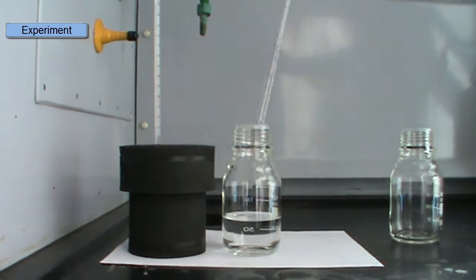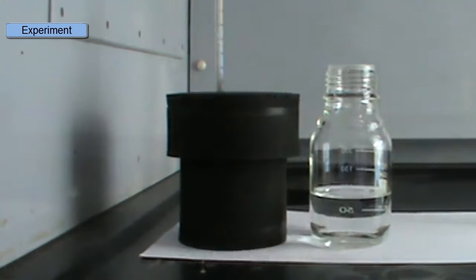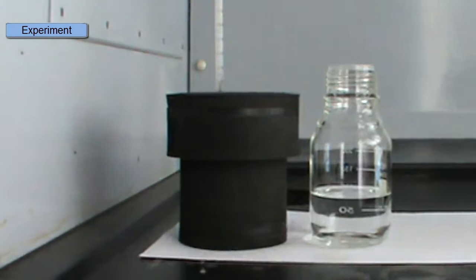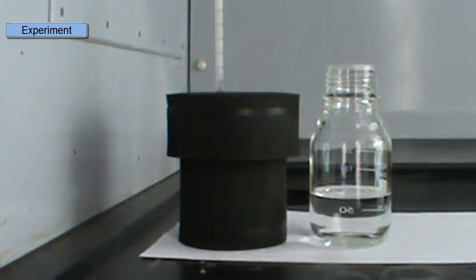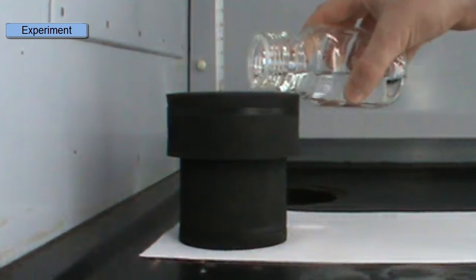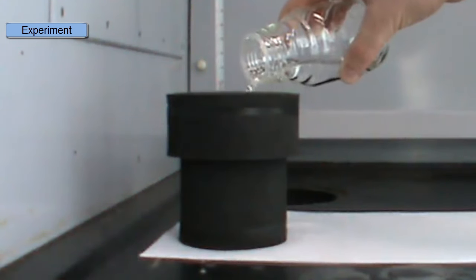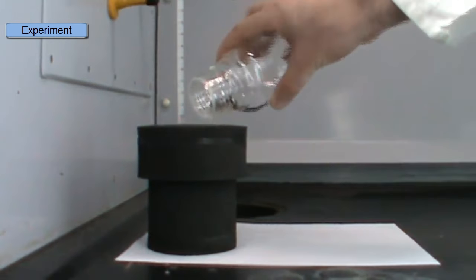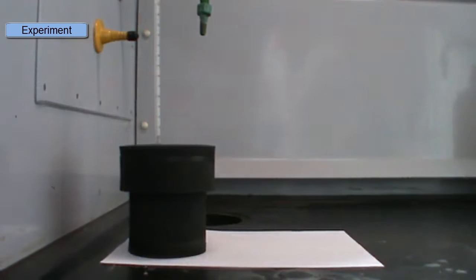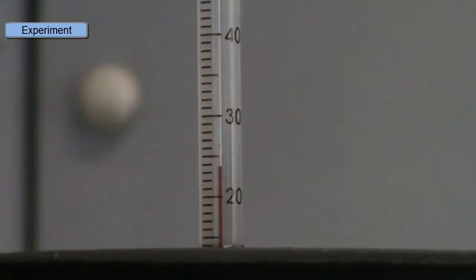Now I can pour in my acid. And as this reaction proceeds, it's going to form salt and water and it's going to give off heat. So that heat will obviously increase the temperature of the solution. So we'll pour in our acid. And after pouring in and mixing, we'll note the final temperature. So we watch the temperature increase and when it levels off, that's the final temperature. So here I've mixed it for a while and now it's at 24 degrees.